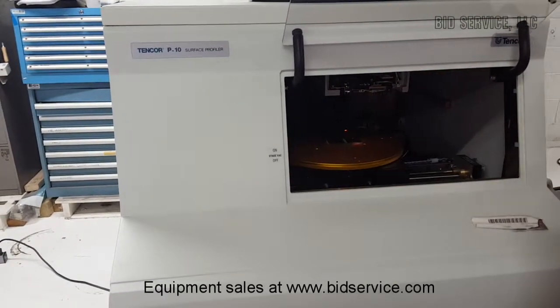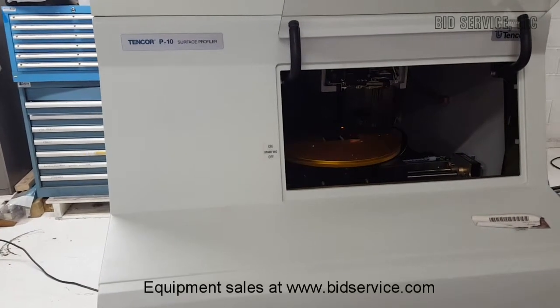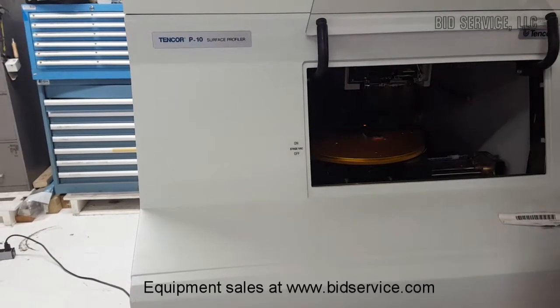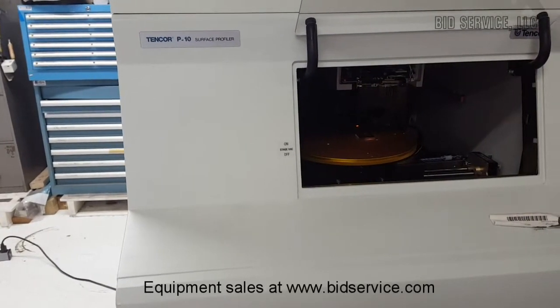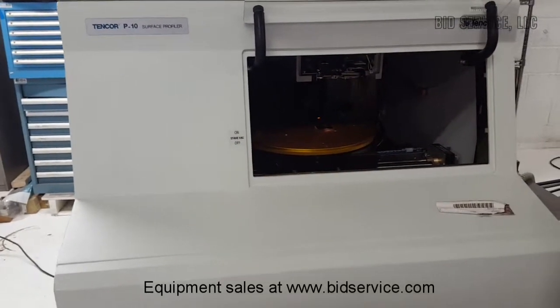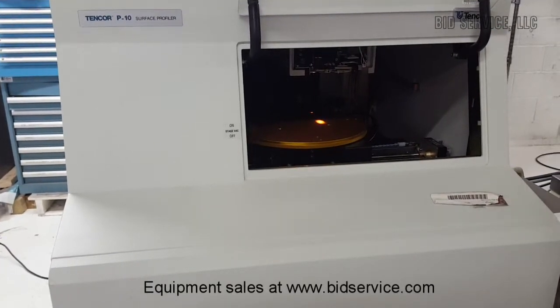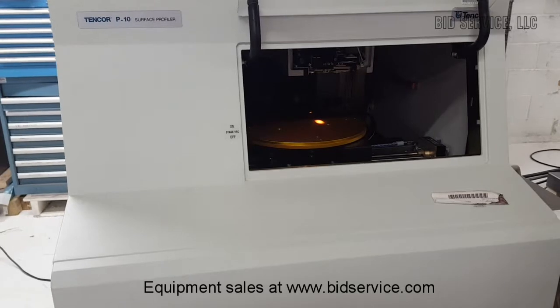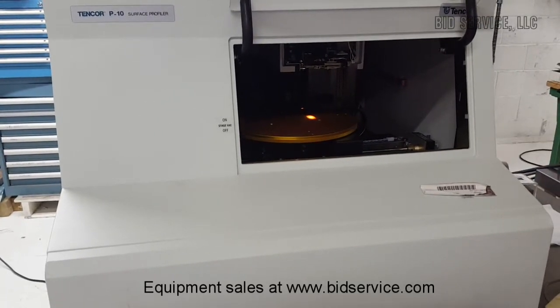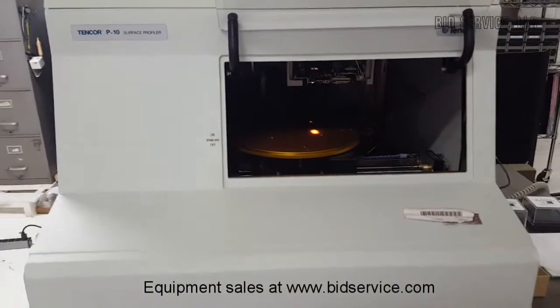So these profilers are very delicate, so always use powder-free gloves, and always watch the tower position when you are switching from a thinner sample to a thicker sample, which is very important. So here it is a 7.8 micron sample.